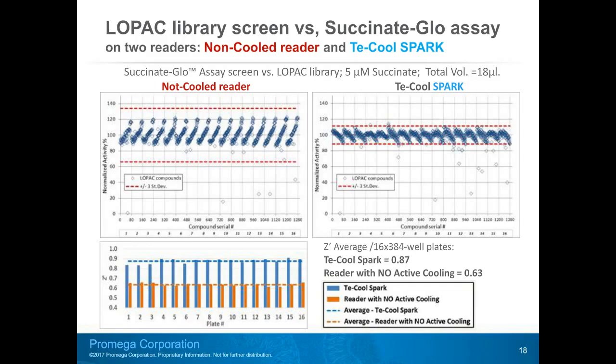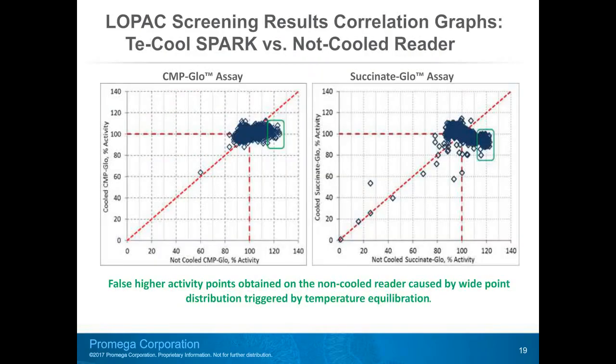Z prime calculations for Succinate-Glo assay reveal an even larger difference between Z prime values obtained on cooled and not cooled instruments. Z prime values averaged over 16 plates for a T-cool reader are improved by 0.24 units. It's a big difference. On both top graphs, the red dash line indicates the 3 times standard deviation line, which marks the limit below which compounds can be selected as hits or active compounds. As you see on the not cooled reader, on the left graph, we can count just 5 compounds appearing below the 3 standard deviations line. On the T-cool instrument data, we can identify by the same assay 24 active compounds.